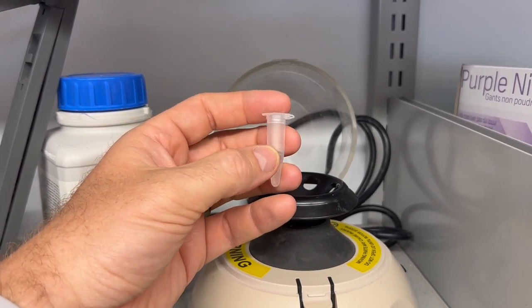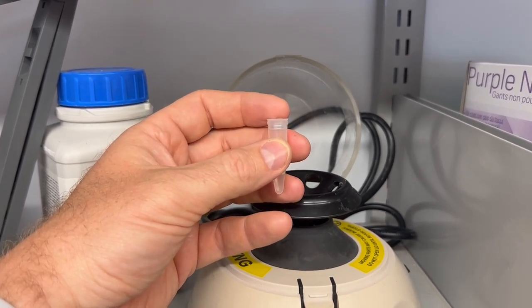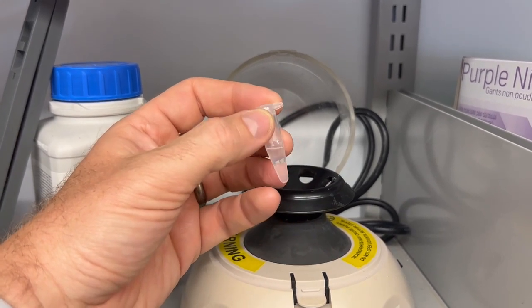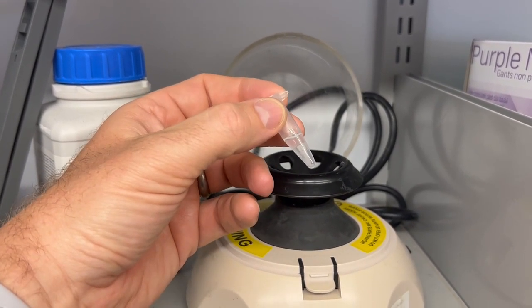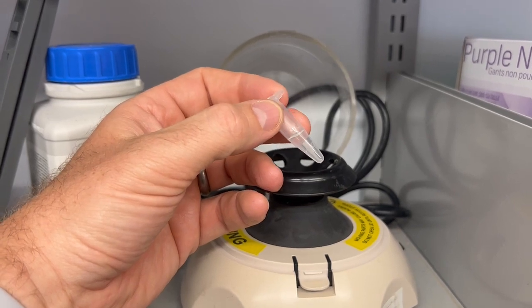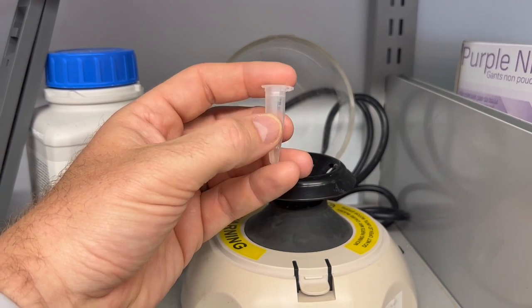Technically, a lot of particles come in their own liquid suspension. You might commercially purchase it, and it may be suspended in some liquid, but you want to suspend it in your own liquid. You want to suspend it in your own conductivity, because you don't know what the conductivity is of the supplier, or you just want to rinse it off completely. And that's what we're going to do here.